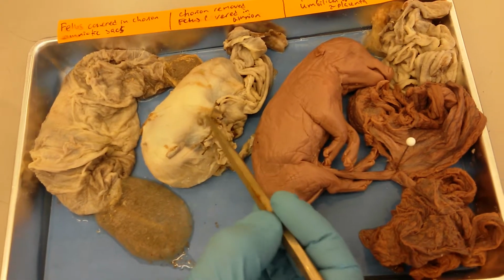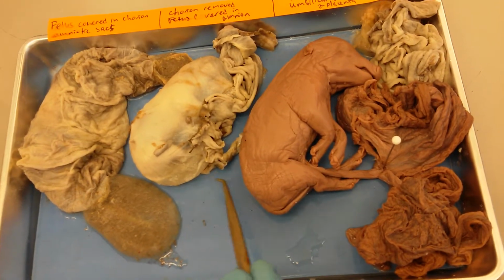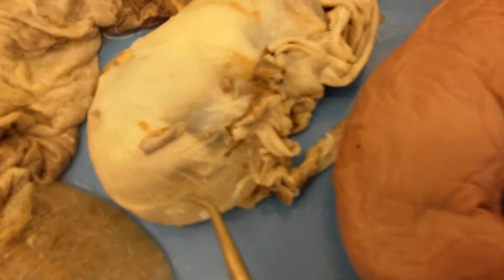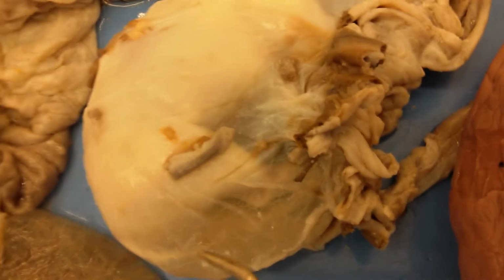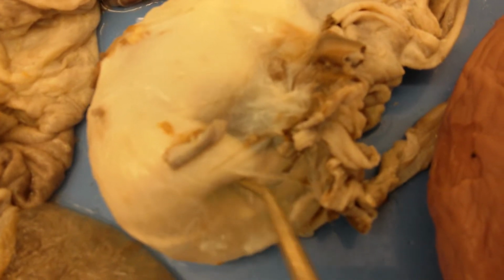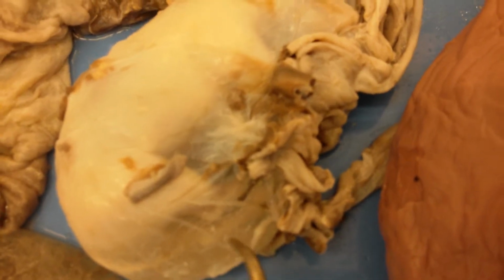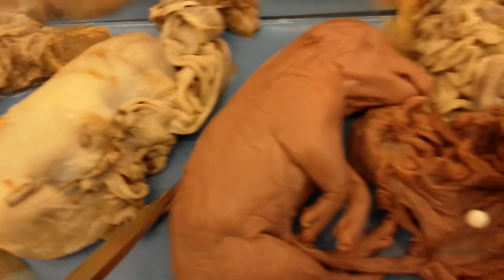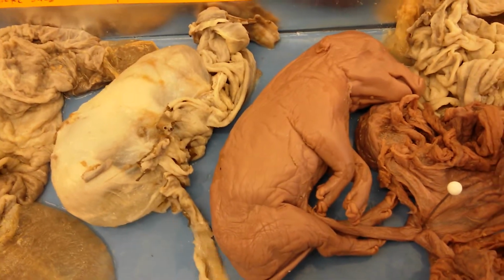And then in this fetus, I removed the chorion, so now you just see the amnion, and you can see it's actually pretty transparent, if you could focus here. So you can actually see the internal structures of the fetus, so you can see the leg there, the tail. So the amnion is really very thin. And this is the umbilical cord. And then we can see this better.